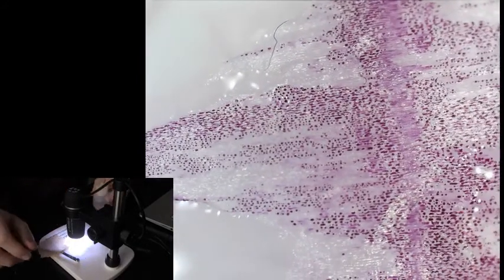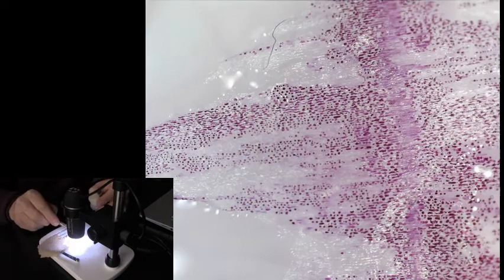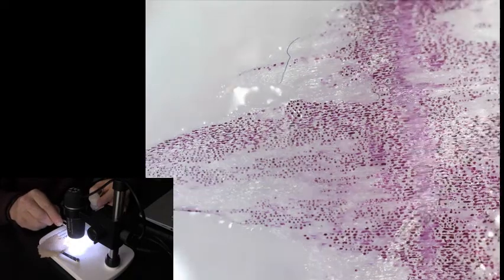I slip the paper towel underneath on the microscope, and I draw distilled water across that slide.